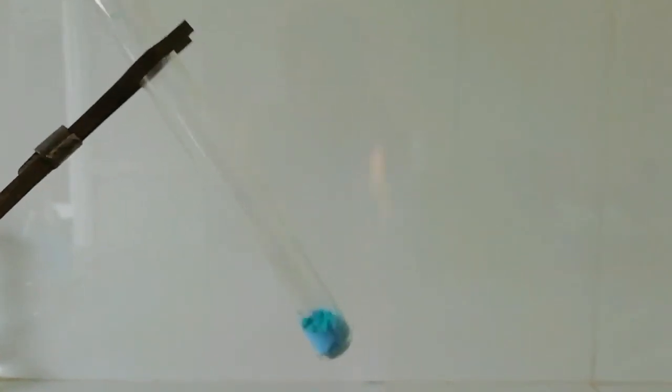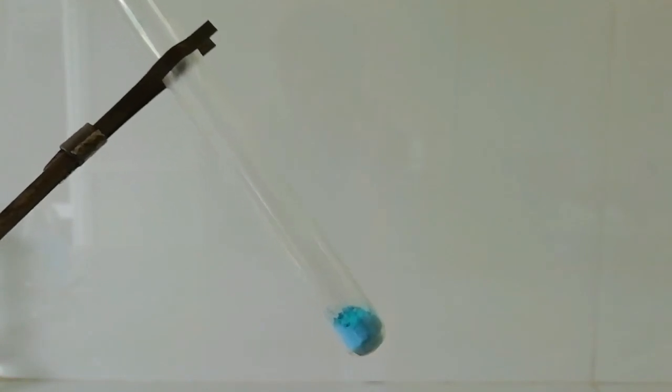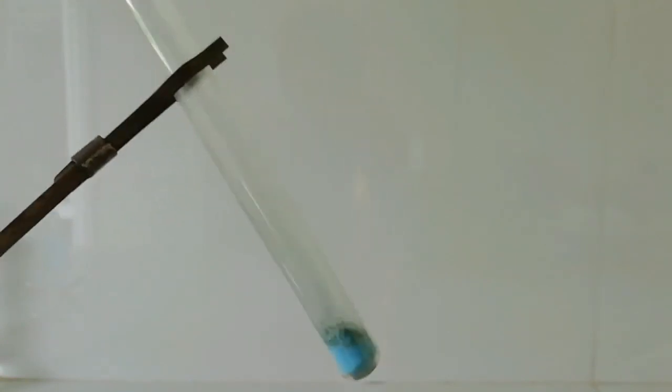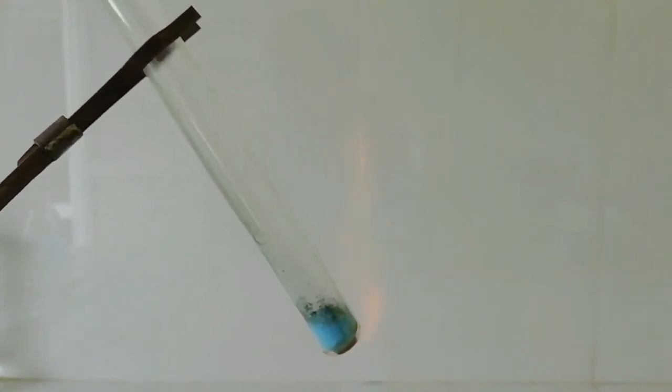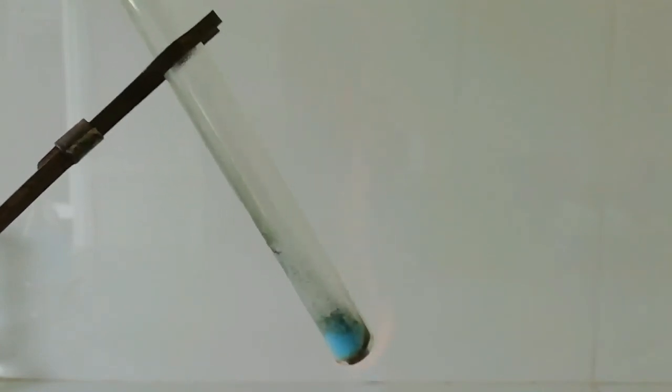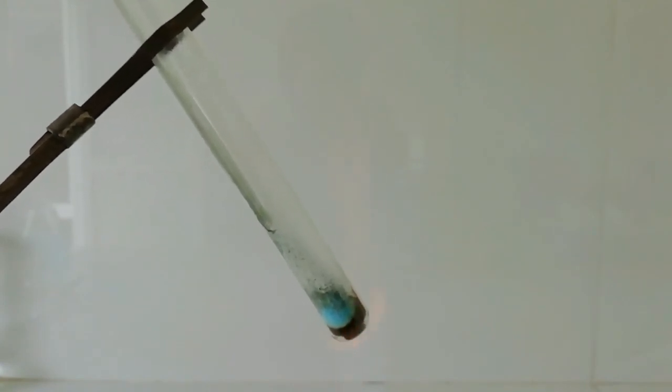When I continue to heat, this copper citrate decomposes and gives very fine particles of copper. Normally copper does not react with oxygen in the air, but these fine particles can react with oxygen in the air and burn.